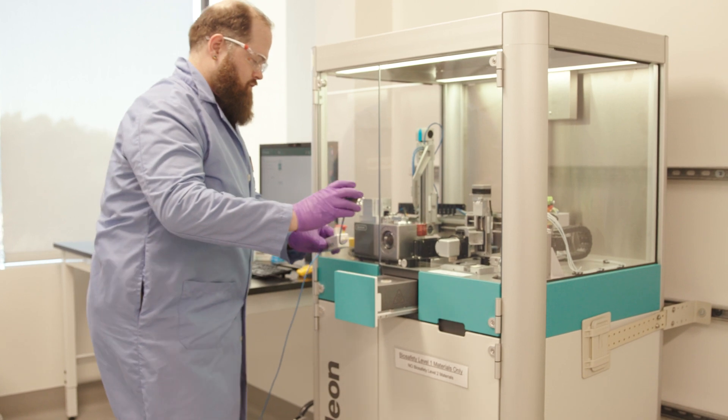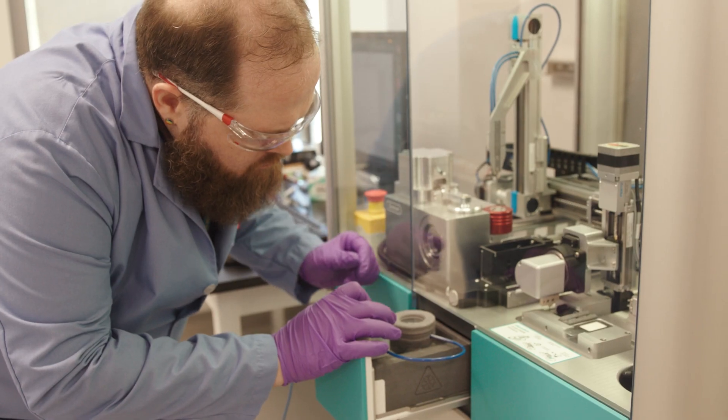What's been developed here and what's accelerating all of biology's understanding of cell processes is the combination of what's called FIB milling — focused ion beam milling — in which you can literally go layer by layer through the cell. And if you combine that with cryo-electron tomography, you can see those structures. What we have here is a very large suite of cryo-EM and cryo-ET instrumentation and x-ray capabilities for the most complex projects that many researchers bring to us.